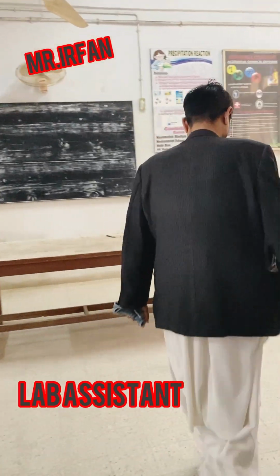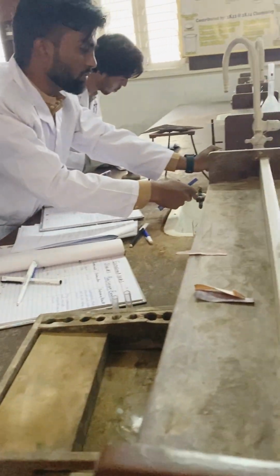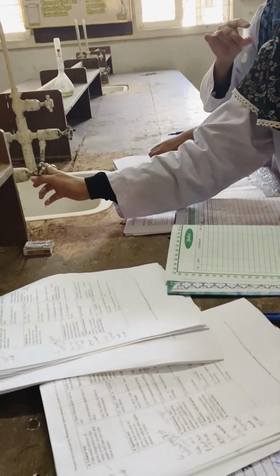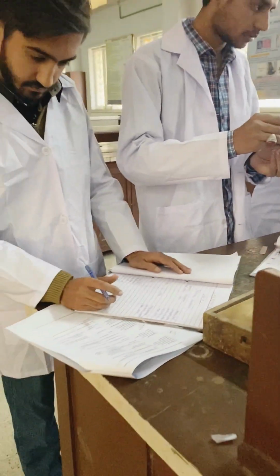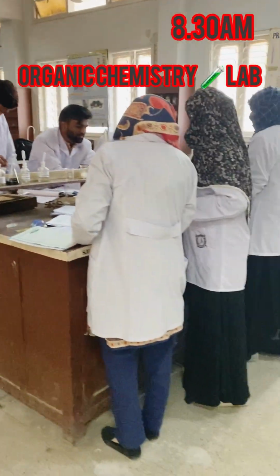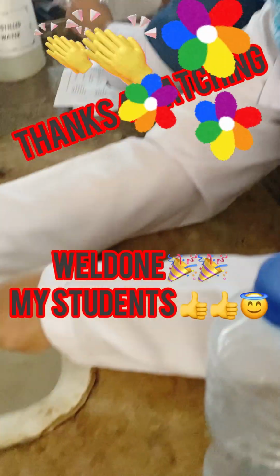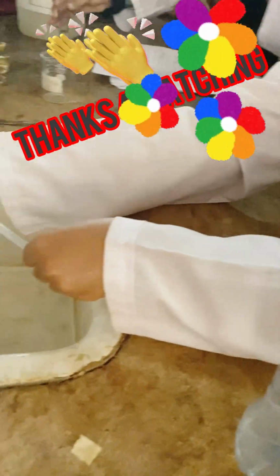Our lab assistant Mr. Irfan is very nice. He's helping me a lot in doing everything. I appreciate his efforts. This is how my lab goes on. It's an 8:30 a.m. lab, the morning lab. And alhamdulillah, my students are working in a very nice way. The girls are working.